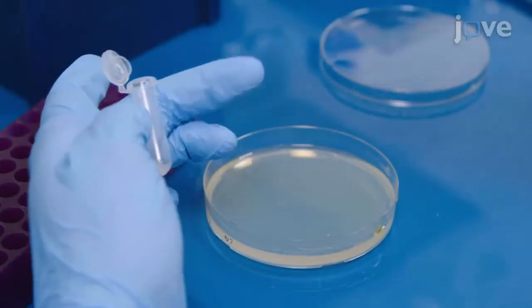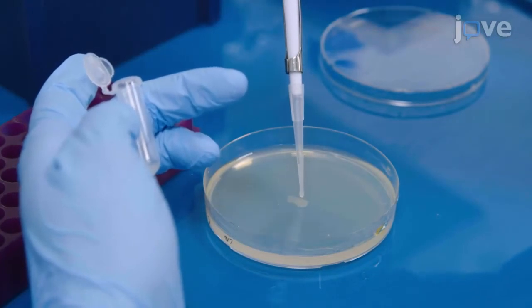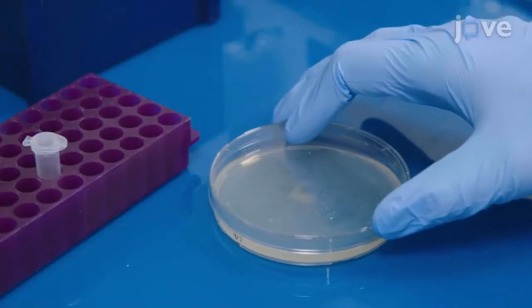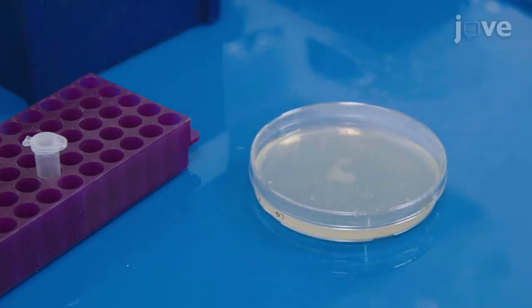Plate a spot of the mixture on preheated LB agar, and incubate it for 5 hours at 37 degrees Celsius.